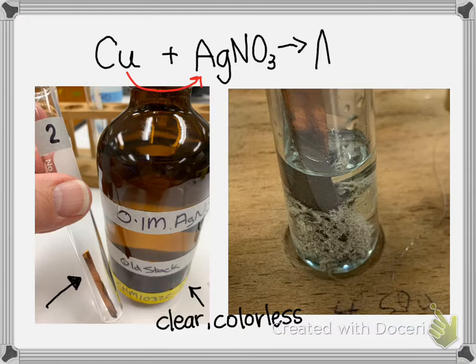And so I have silver. And do you see the flaky, hair-like material that's silver colored? That is silver. Looks cool. And it is coming out and forming the copper nitrate.